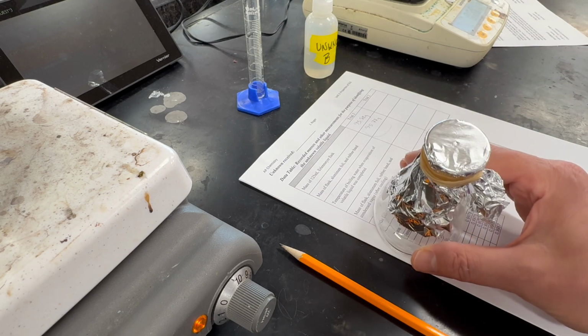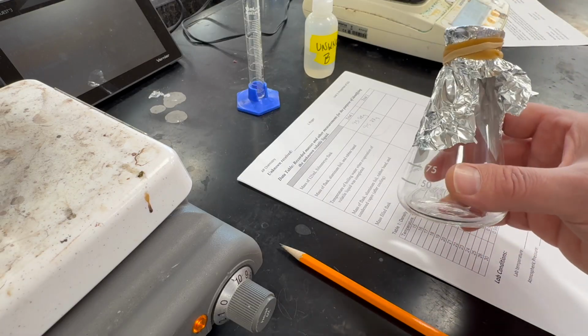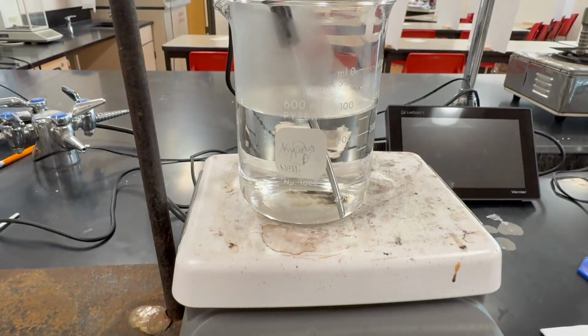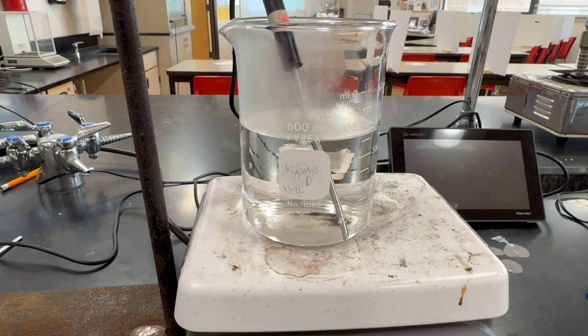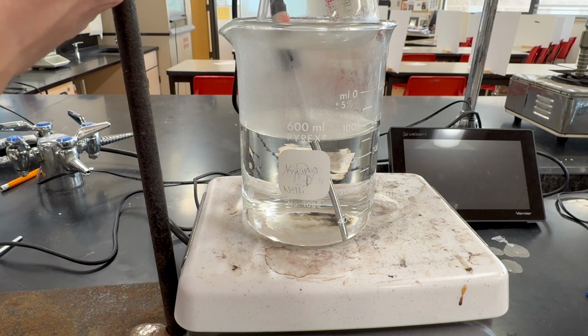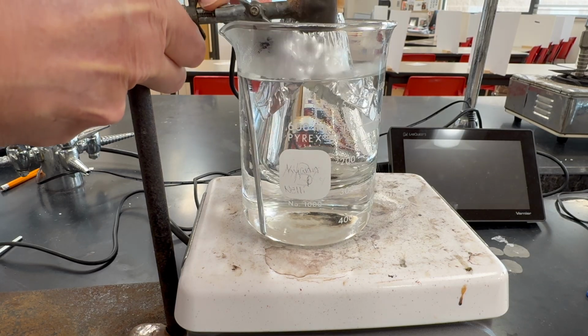And this is because we have 2 milliliters of liquid in here, so it's going to more than fill up this flask. So we're going to evaporate the liquid, and the excess will leave the flask through the hole. And the hole is also there so that we know that the pressure inside the flask will be the same as the atmospheric pressure.